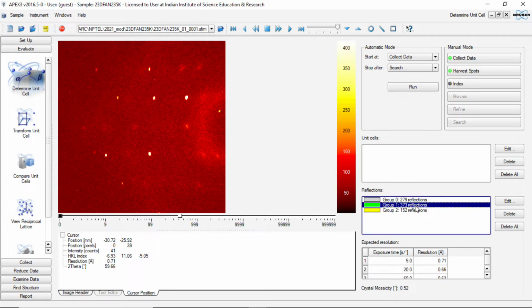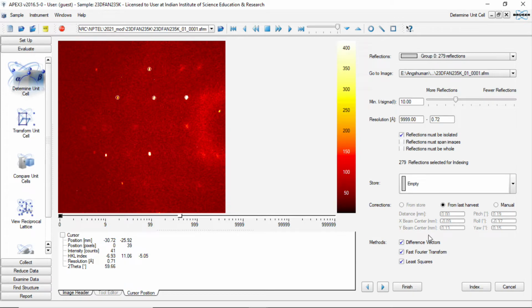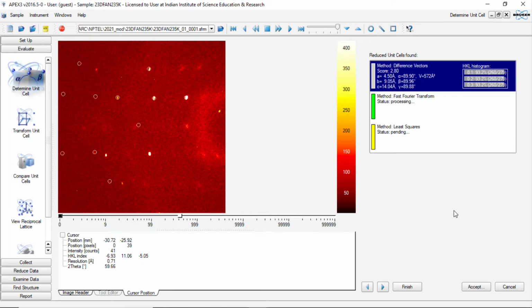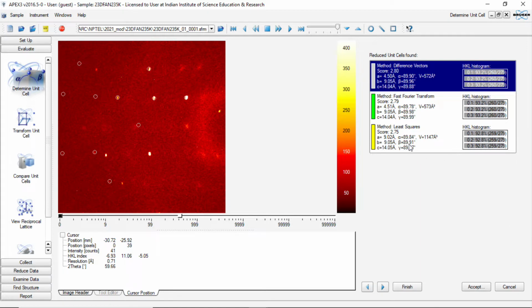Green don't correspond to anything. We will worry about it later. The gray and yellow correspond to some unit cell. So let us now try to index with the reflections which are in gray. Now you see, it is very easily giving the unit cell as 4, 9, 14. The second method also has given 4, 9 and 14. Third method sometimes struggles, but it gives a different unit cell with a different figure of merit as well. So by default, the top one is taken as the unit cell.